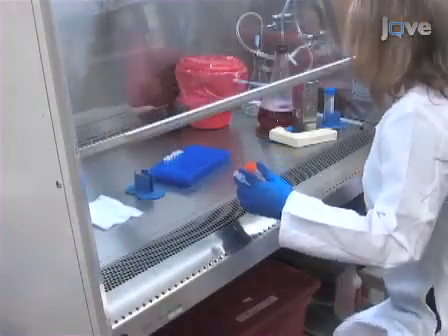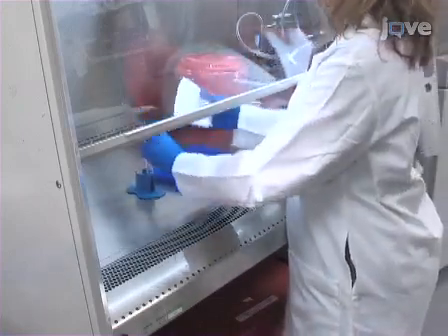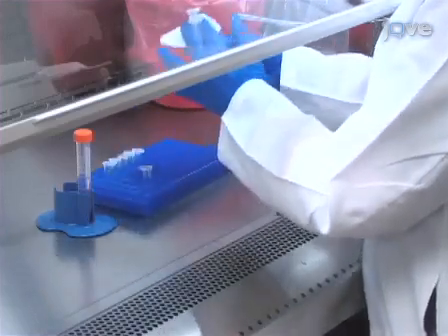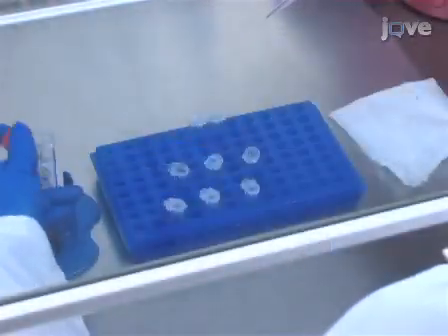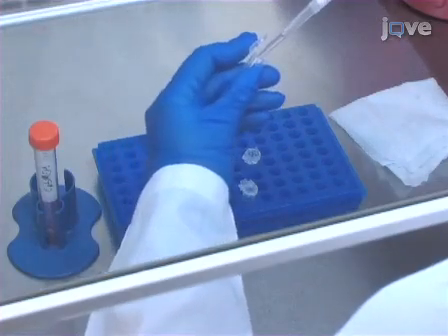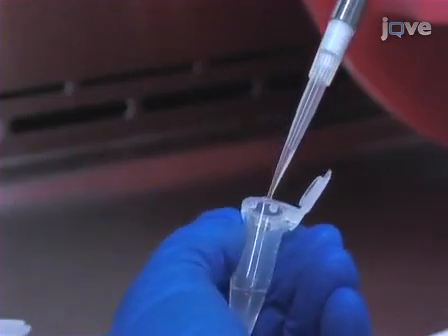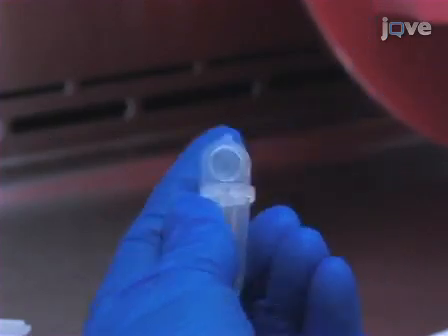The next day, begin transfection in the late afternoon. First, collect an aliquot of Opti-MEM and the transfer, packaging and envelope plasmids and allow these to warm to room temperature. Pipette 375 microliters of Opti-MEM into a microcentrifuge tube and then add 25 microliters of FuGENE HD transfection reagent. Ensure that the FuGENE reagent is pipetted directly into the media and does not touch the side of the tube.